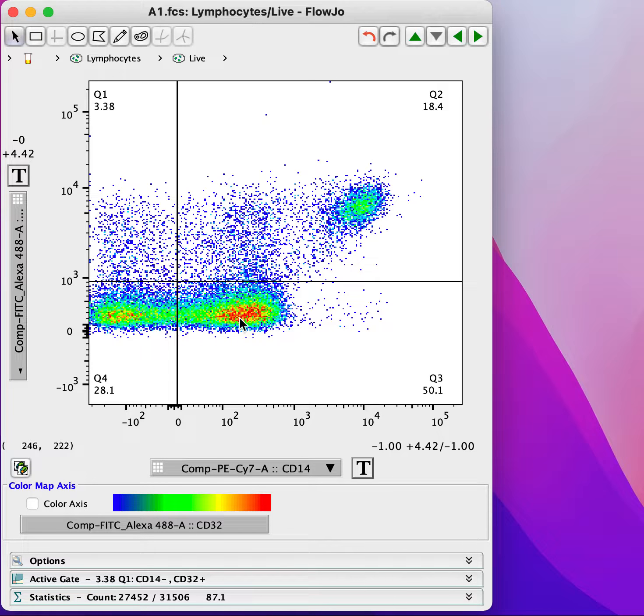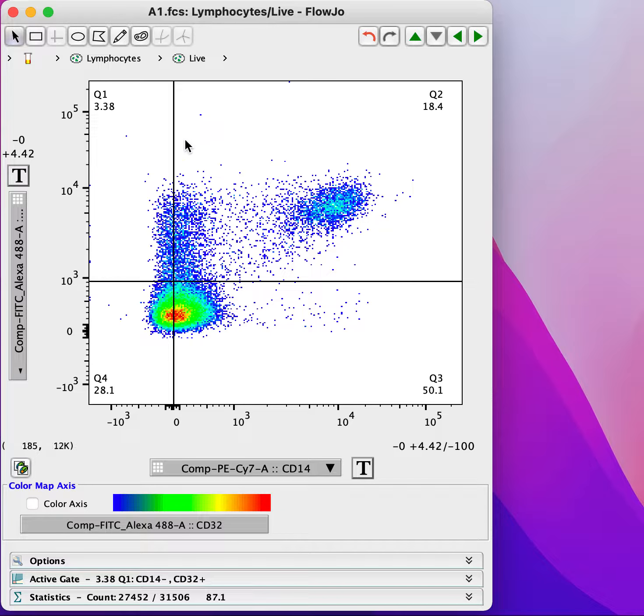That should send up a warning because you would not expect a flow cytometer to have any kind of resolution at this level of the scale. This is the area where the differences in signal here are just dominated by noise and random fluctuation. Let's reset the scale and see how our gate looks. And you can see that where we place the gate there just bisects this population.